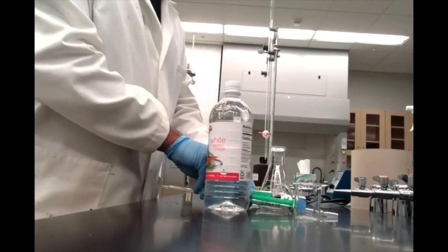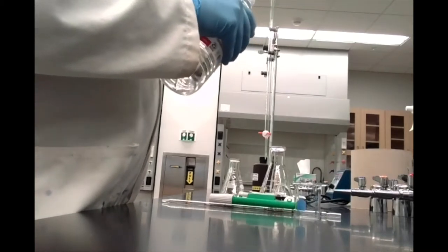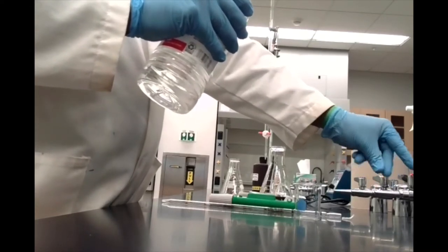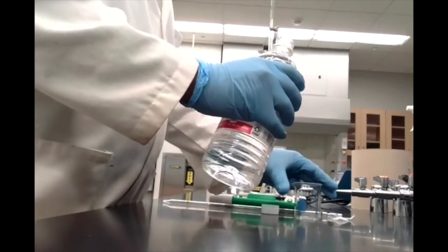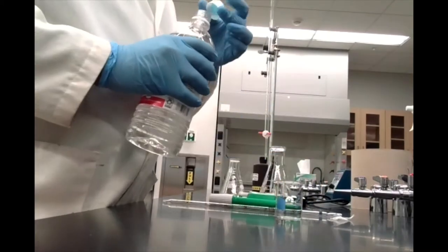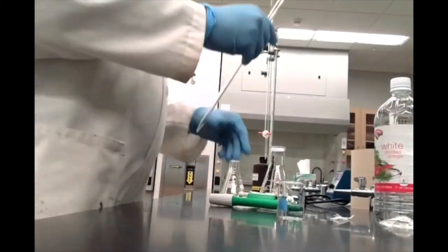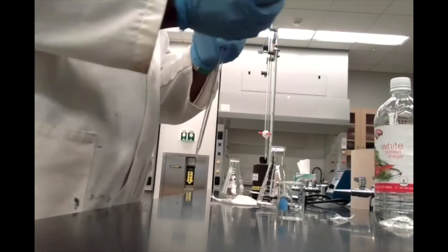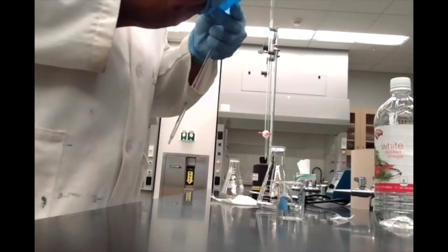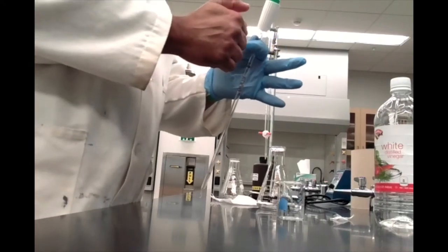I'm going to start by pouring some vinegar into a beaker — that'll make it a little easier to get a volume of vinegar and prevents me from contaminating our stock bottle. We're going to need three trials, so probably about 15 mL or so of vinegar. Taking our clean, dry pipette, we'll add our pipette bulb to that. I'm actually going to take off one of my gloves — it's hard to adjust the volume with a gloved hand; I find it easier to form a seal using my bare thumb.